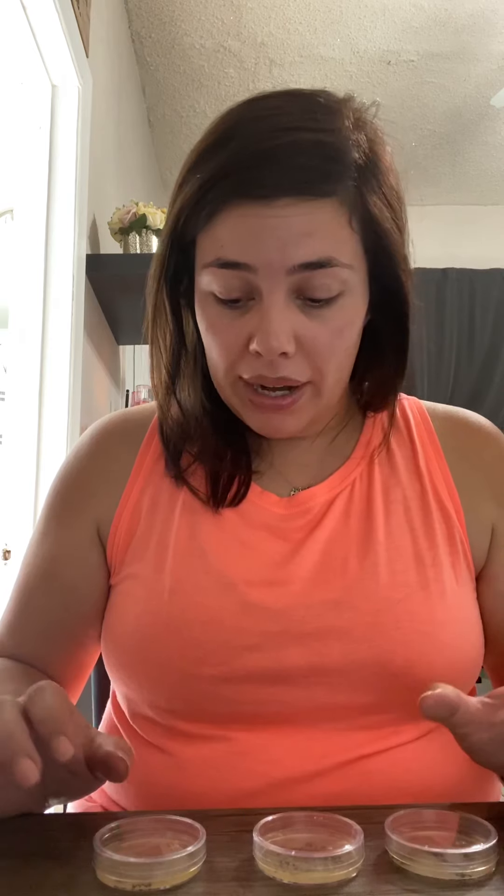Some of what I noticed was on my E. coli dish, it probably had the most growth, which I want to say is kind of expected. One thing I was noticing was within the first two spreads, I might not have fully re-sanitized — I know I sanitized with alcohol — however it's a very similar smear. I would have expected to see some change like we did further down, but they look very similar. I probably smeared most of what was on the first side down to the second, which is why it looks pretty consistent with not much of a difference.